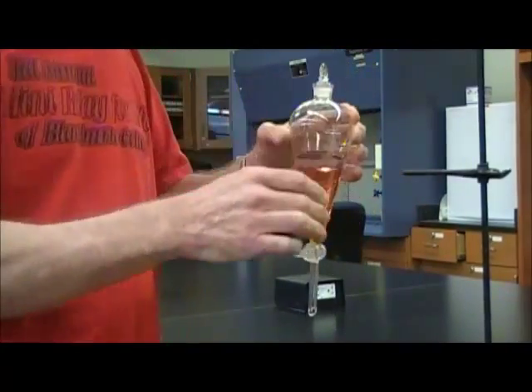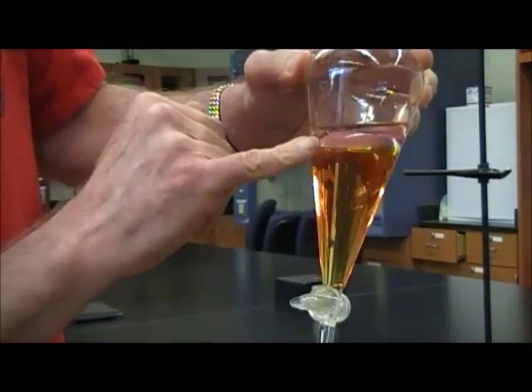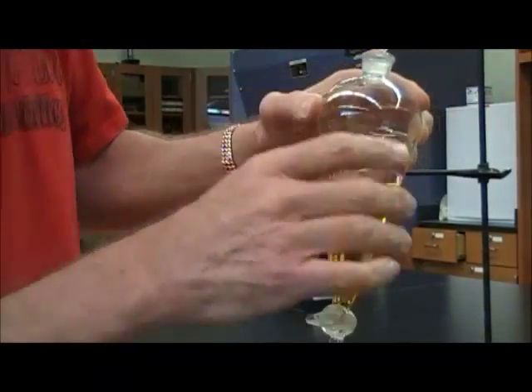And before I mix them very well, notice that there's two separate layers, and there's a clear dividing line between them. Top, bottom layer, top layer.